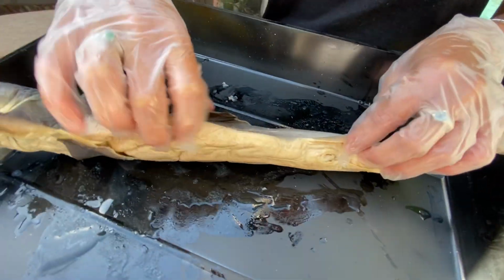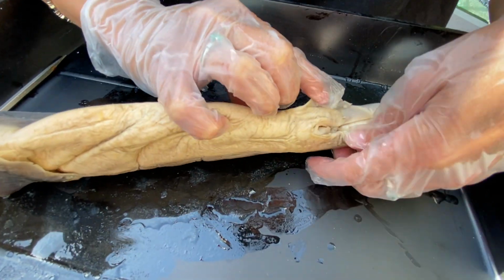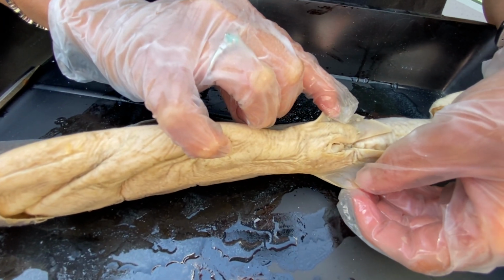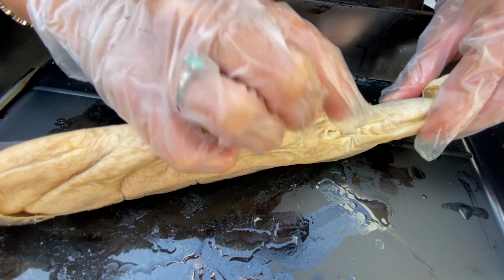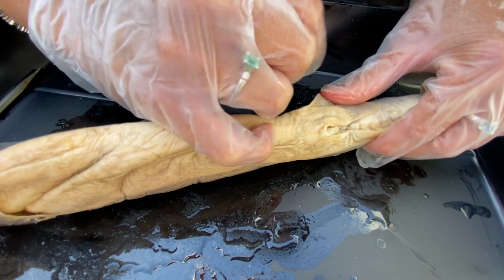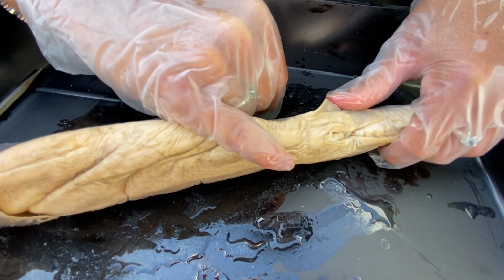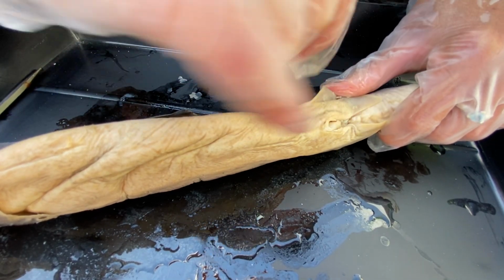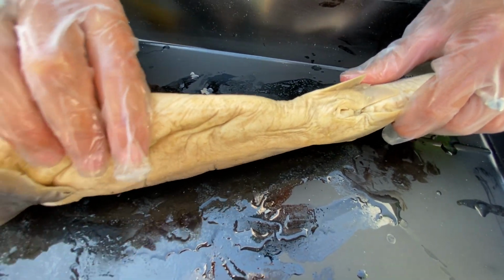On the ventral side of the shark, this is the pelvic fin, okay? Pelvic fins are smaller. They are mostly for stabilization as well. And in between the pelvic fins, if it was a male, it would have had claspers. So this does not have claspers, or two finger-like projections that are right here. So this shark is a female.